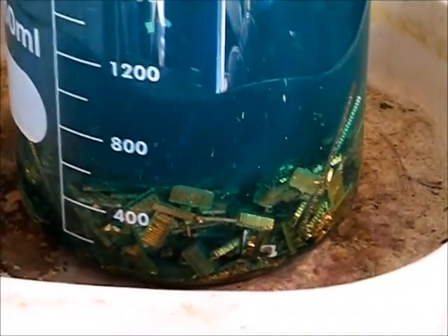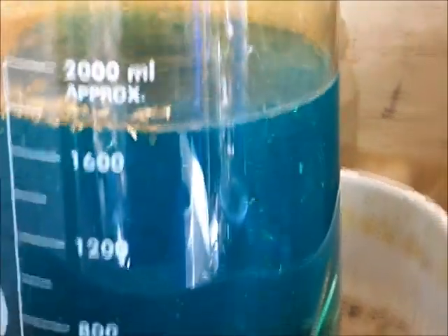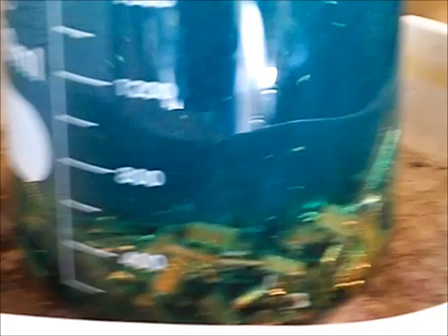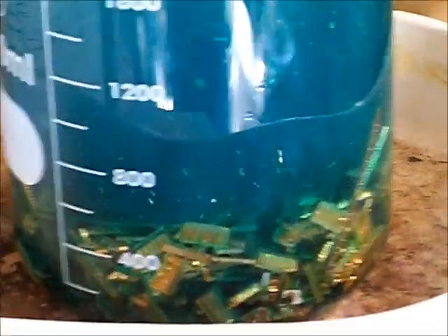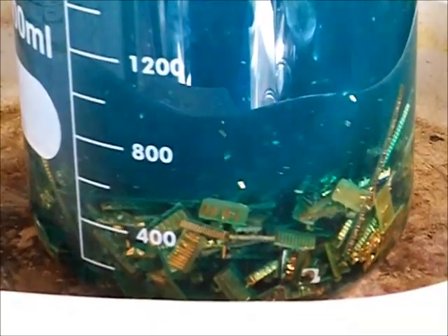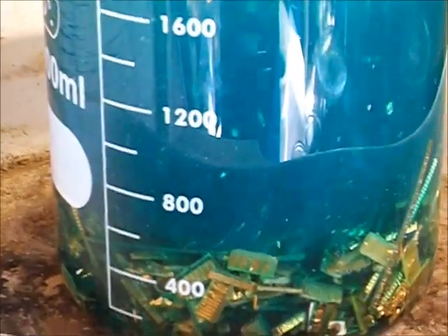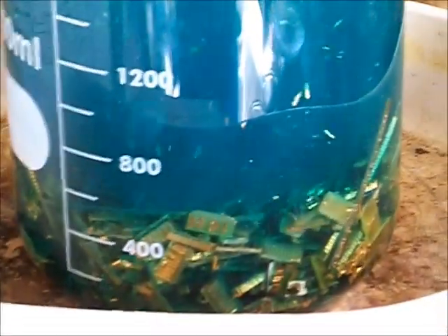This has still got some ways to go because you can still see plenty of gold on those fingers, but there's plenty of gold in there flying around. This is the process that I use to make poor man's nitric. As you can see, it doesn't dissolve any gold.